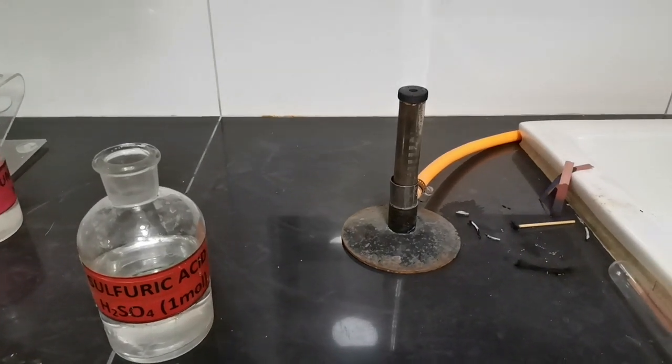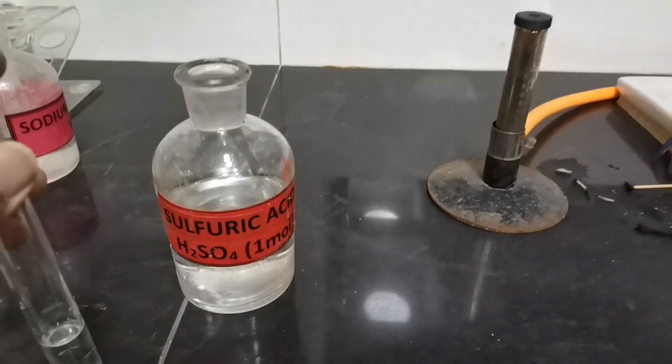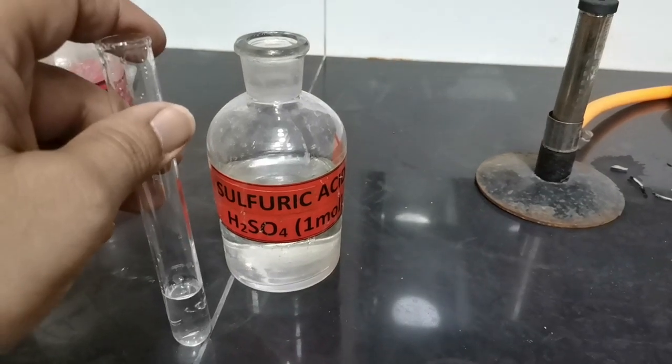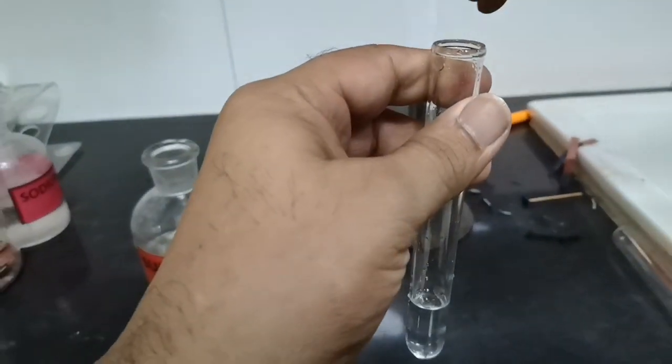Hi guys, we will be testing for hydrogen gas today. I have poured some sulfuric acid into this test tube to which we will be adding magnesium ribbon.